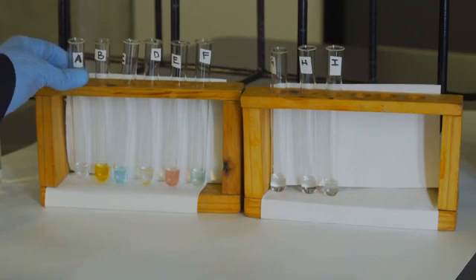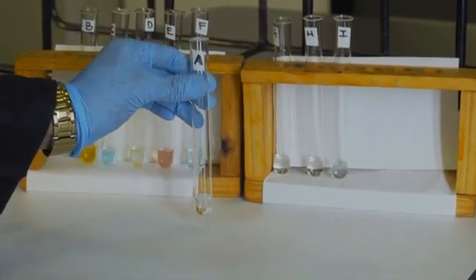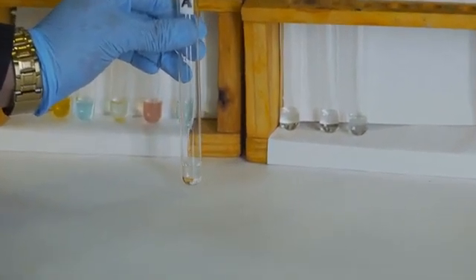To our unknown solution A, a clear solution, we shall add in 3 drops of our ammonium chloride and 5 drops of the ammonium hydroxide.